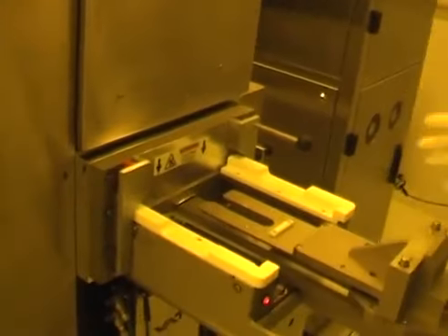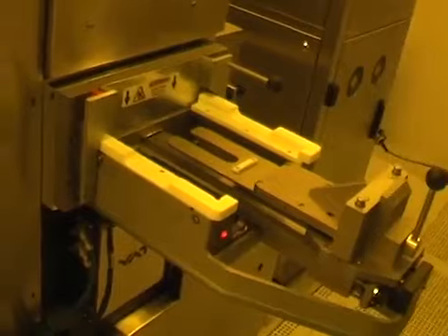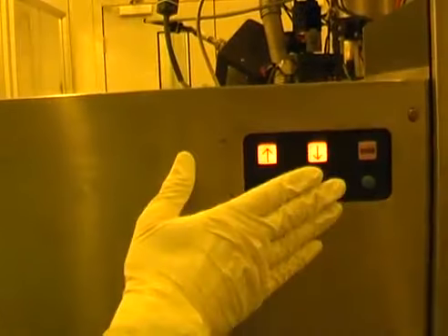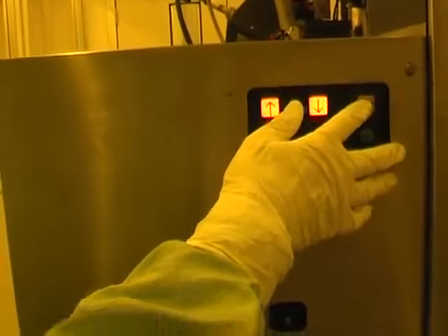If we come across here, this is the loading area, and as I said before, the vent button's around the corner, and we need to vent the airlock, which I do here. That's now venting. It takes 2 or 3 minutes to vent, and when it's vented it will make a big hissing sound, especially if I have the door open. So that will tell us.